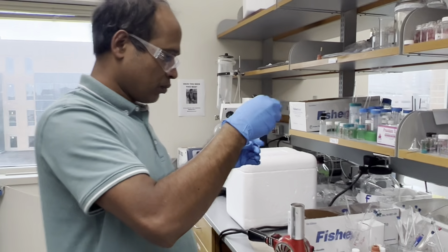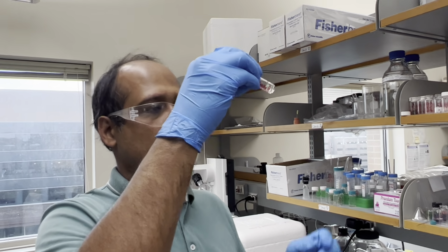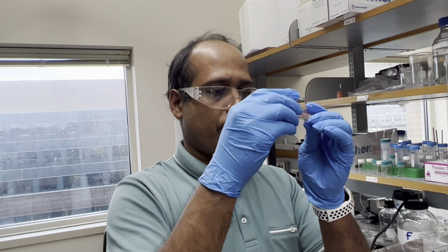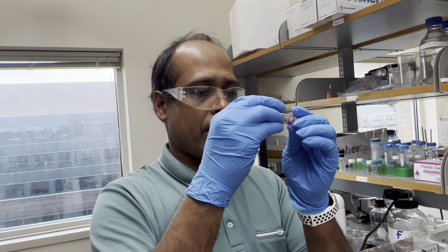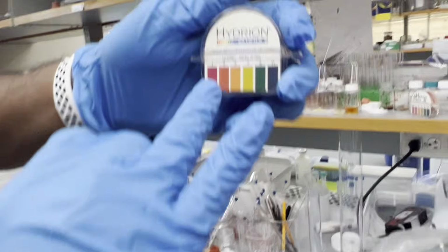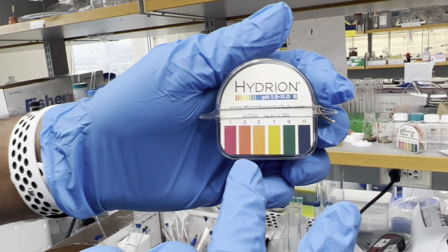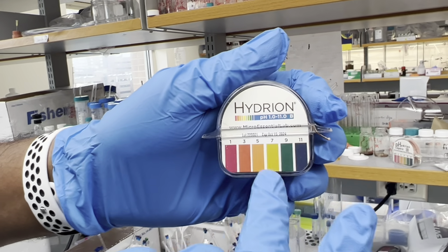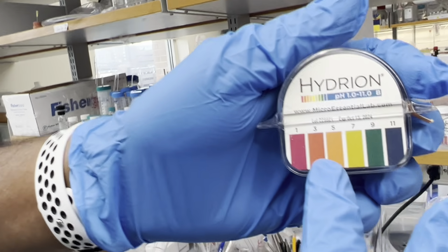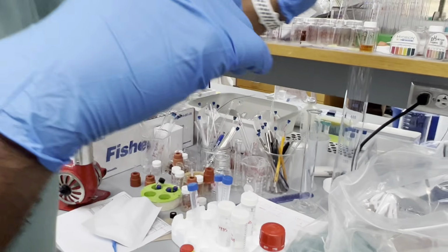So you want the pH to be a little bit below 7. How low is too low? A pH of 4.5 to 5 is fine, but you cannot measure exactly. On the pH paper you can see the color. Somewhere there is 5. To me, 5 and 7 colors are literally the same. You're very colorblind.